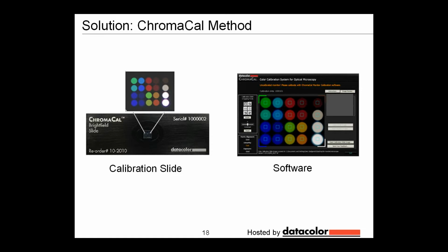Here's a method that I'm using now for going about this process, and it's a product that's been out for about 9 months. This product includes a calibration slide and then software, and that calibration slide has a matrix of colors against which images are then standardized. This image would be taken at each microscopy session, and then from this image you would standardize these colors and then apply that standard to images in the software. You can also get this with a monitor calibration, hint, hint.